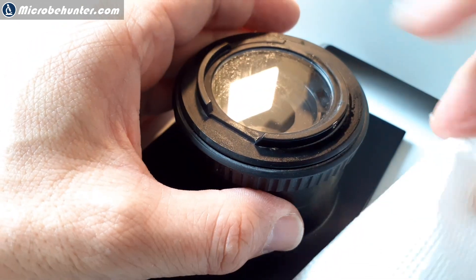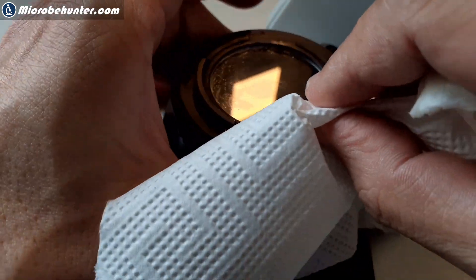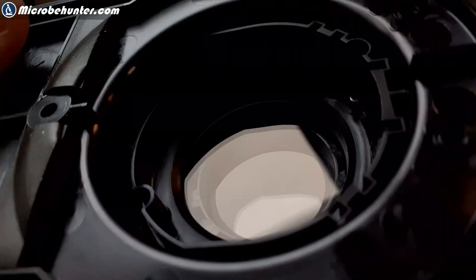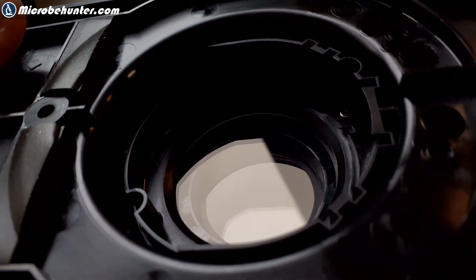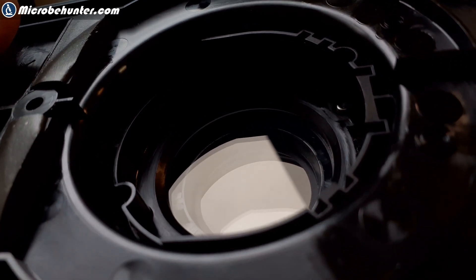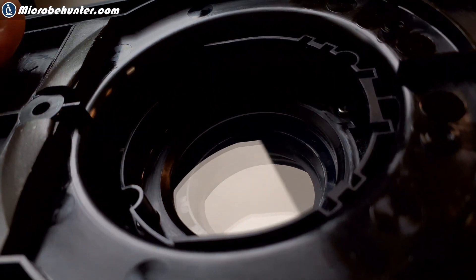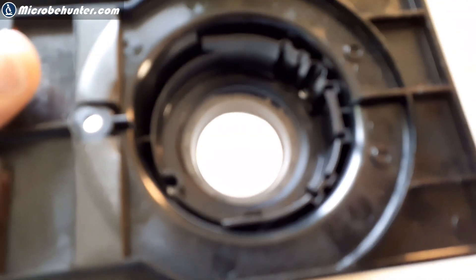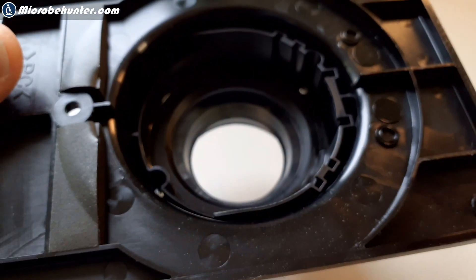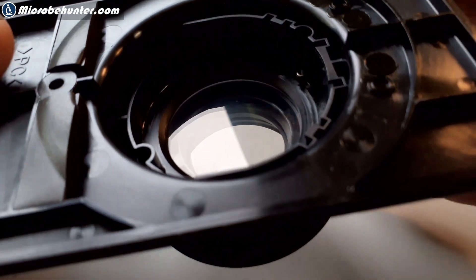I think this was really necessary to clean. It looked quite okay, just holding it against the light this way. However, something that you do not see quite well here in the video is that there was actually a thin layer of dust and dirt covering the glass plates.